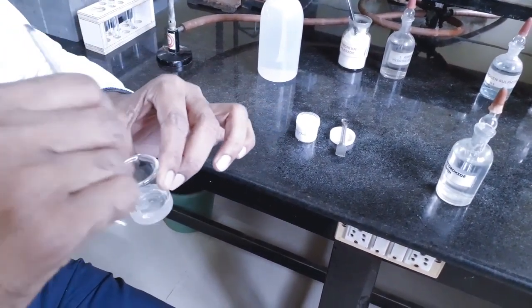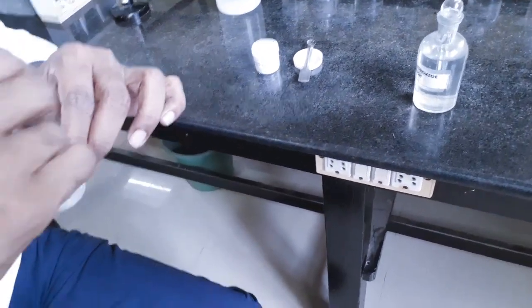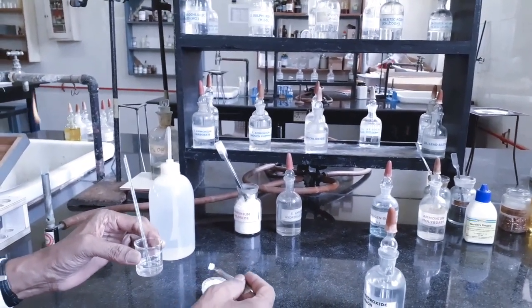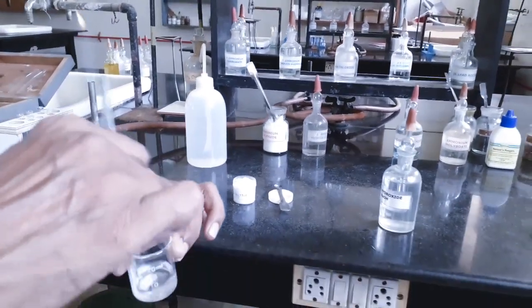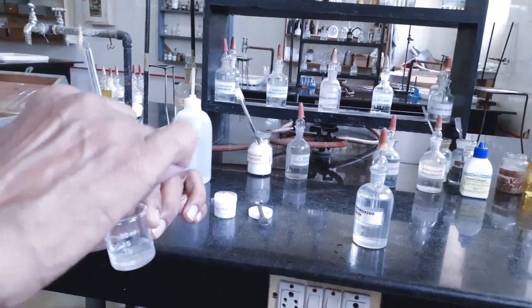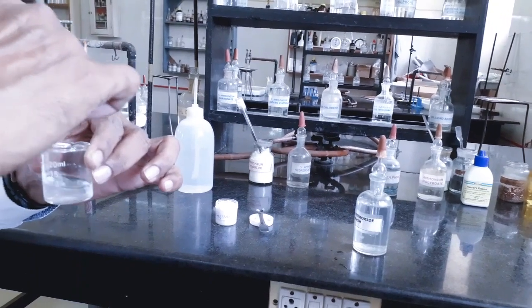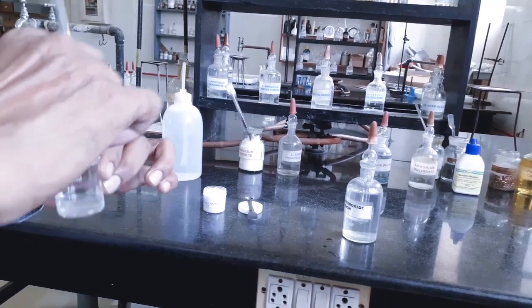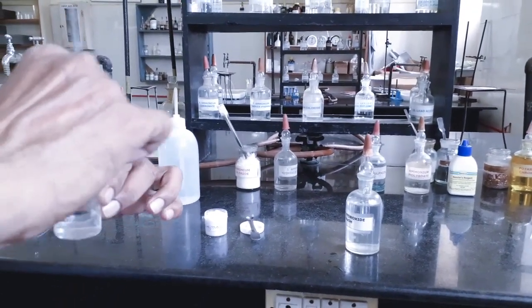We are supposed to dissolve the salt with minimum amount or volume of solvent to get concentrated solution, so that proper precipitation takes place in the analysis of basic radical or detection of basic radical. If the solution is diluted, then a sufficient number of cations, basic radicals may not be available, and there will be no proper precipitation, and our observation may not be proper.